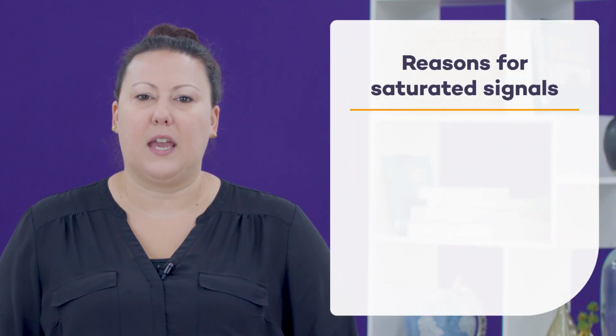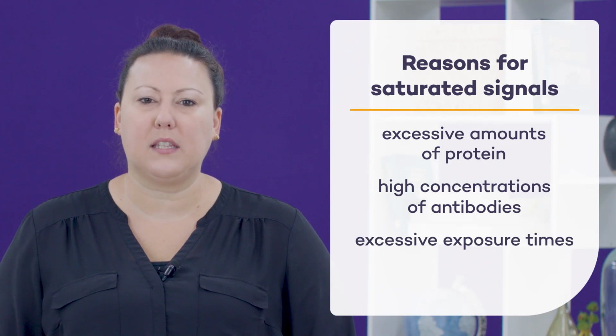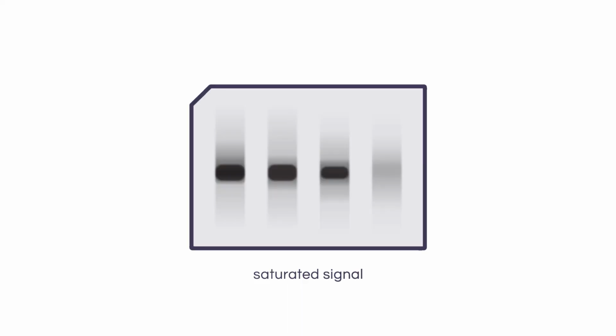Another issue is having excessive or saturated signals. Excessive amounts of protein or high concentrations of antibodies, along with excessive exposure times or wrong sensitivity substrate, can lead to saturated signals. These signals are no longer proportional to protein concentration and may therefore not be used for quantitation of the target protein. The high diffuse signal intensity also makes it difficult to resolve protein bands that are very close together. Reduce the concentration of the antibodies and confirm you are working within the linear range of your target to help avoid diffuse signals.